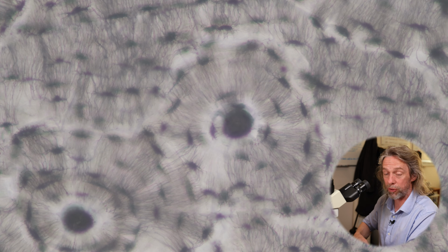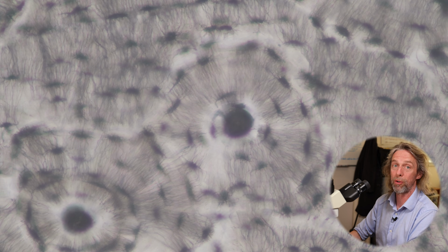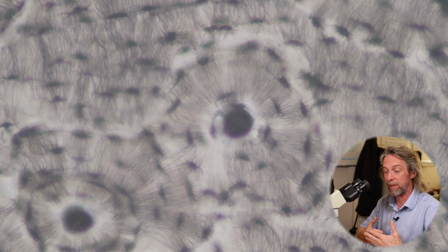So we've got a little artery, a little vein, probably going to be a nerve in there, maybe lymphatics. Because bone also has a great nerve supply, which is why when you fracture a bone, it's really painful. And that pain stops you moving and lets the bone repair itself.